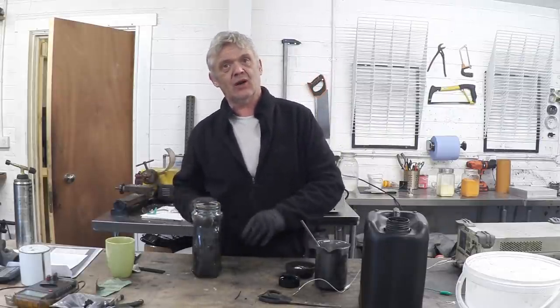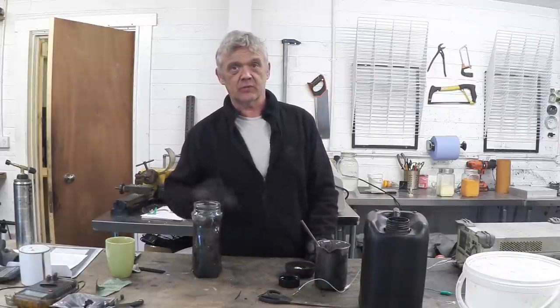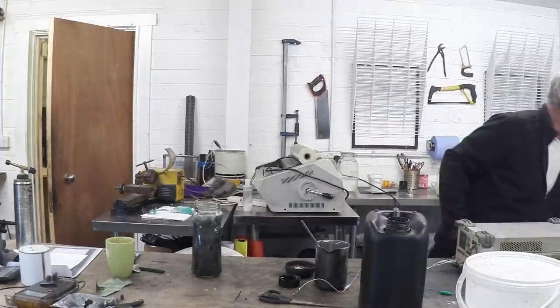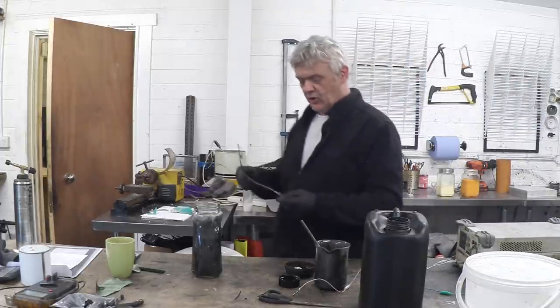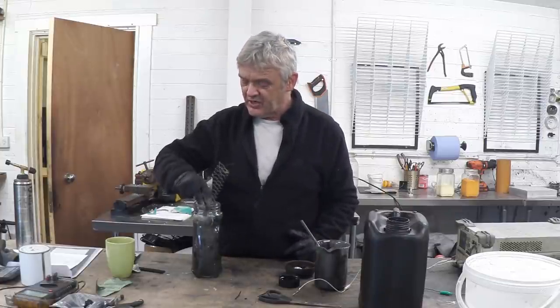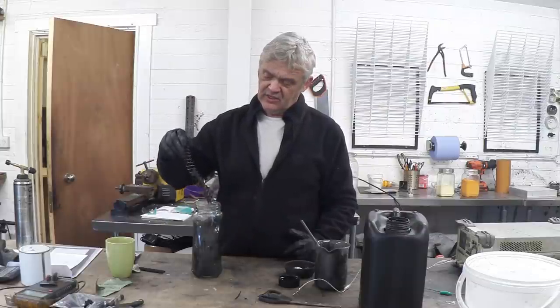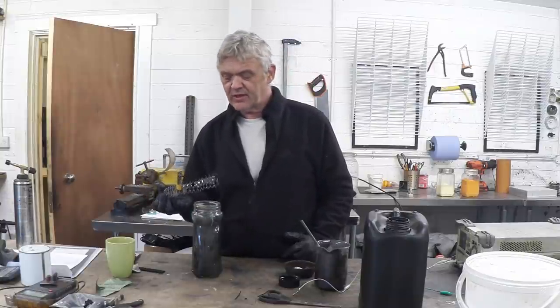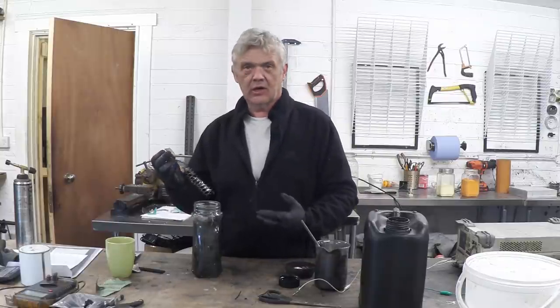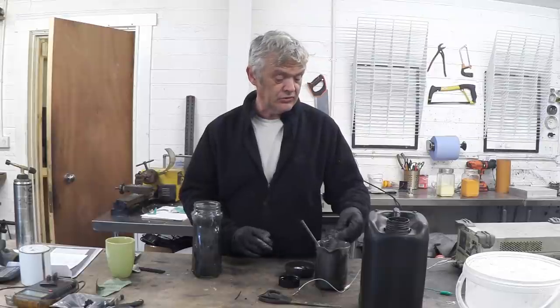What I would normally do is put that lid back on, leave it so everything distributes, and give it a shake every now and then to keep a nice mix. What I've got here is a bit of stainless steel mesh — if I dip my stainless steel mesh in there and bring it out, it coats itself in a plastic coat. We leave that to dry and then do that a couple more times so that we get a coating of that conductive plastic on our mesh, which we can then use to make electrodes.